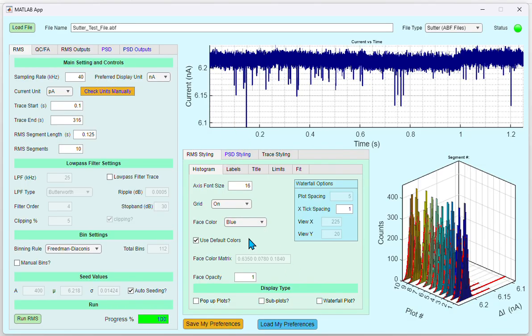If you want to use your own colors, unselect Use Default Colors and enter the color matrix in the Face Color Matrix field. This is a 3-number input that varies from 0 to 1. Each of the number columns represents the red, green, and blue components of the target color. You could also set the face transparency using the face opacity option.